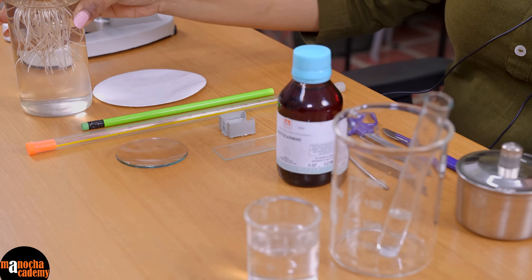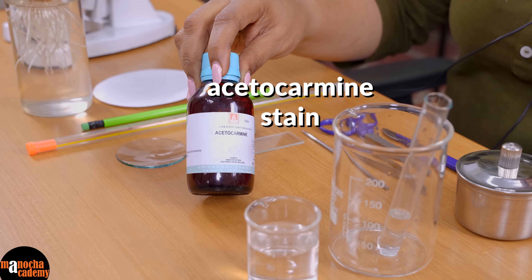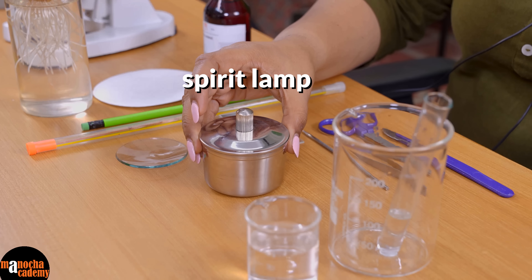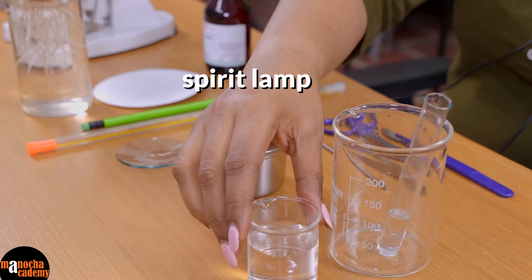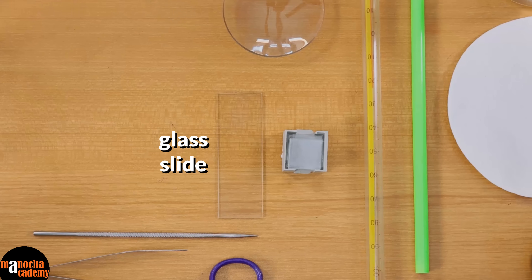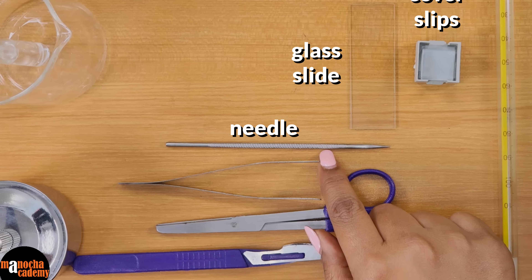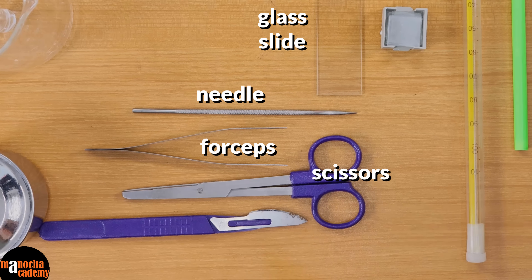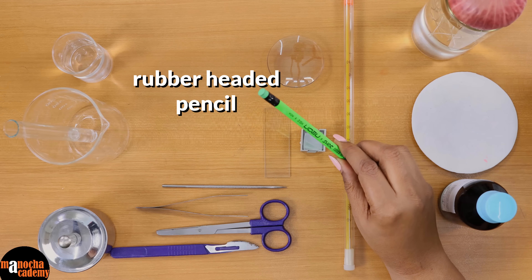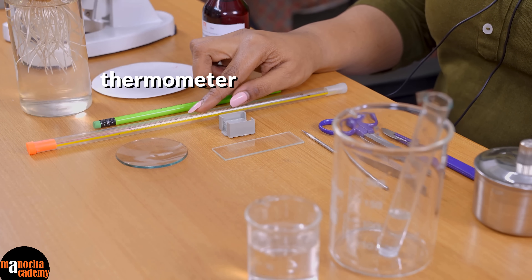We will be needing a stain. In this case we will be using acetocarmine, which is a stain obtained from an insect. We will be needing a spirit lamp, some distilled water, glass slides, watch glass, cover slip, needle, forceps, scissors, scalpel, a rubber headed pencil like this for squashing, and a thermometer.